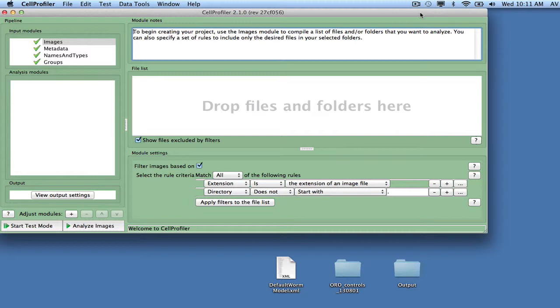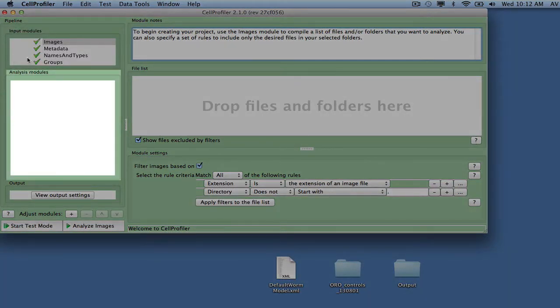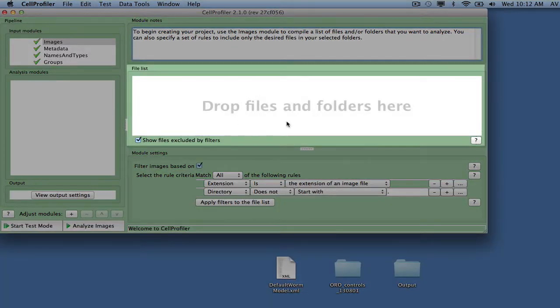To begin, start CellProfiler 2.1, or alternately save any previously created projects and then clear the pipeline. The CellProfiler interface consists of the pipeline panel to the left, which is divided into input modules and analysis modules. A space for module notes for annotations, and a file list will appear to the right.